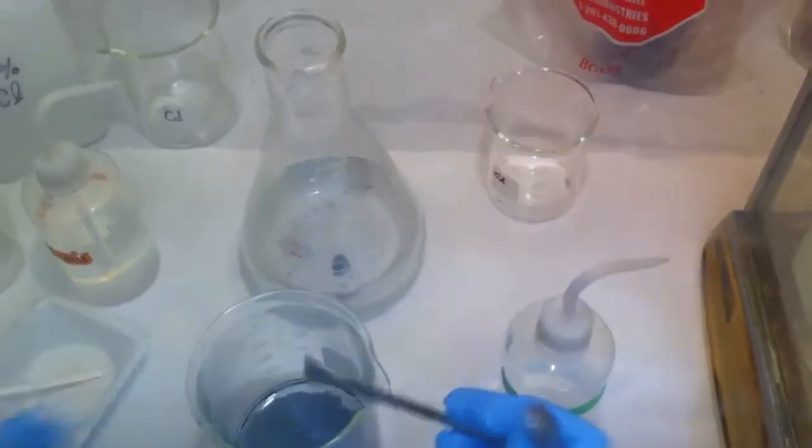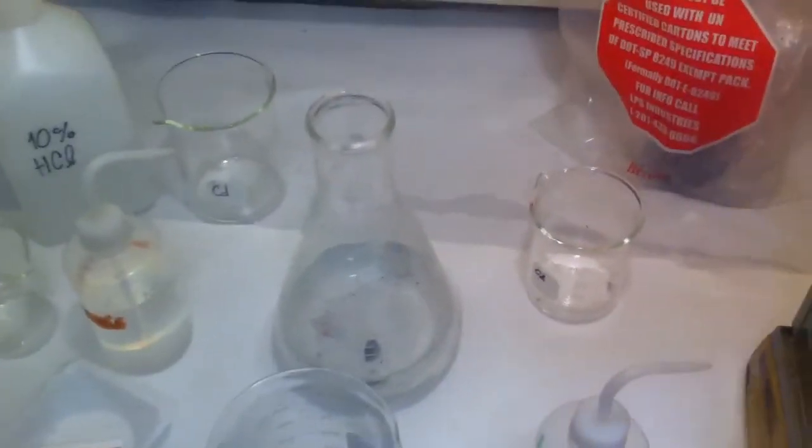Now let me check the pH on this. Let's see if it's higher.